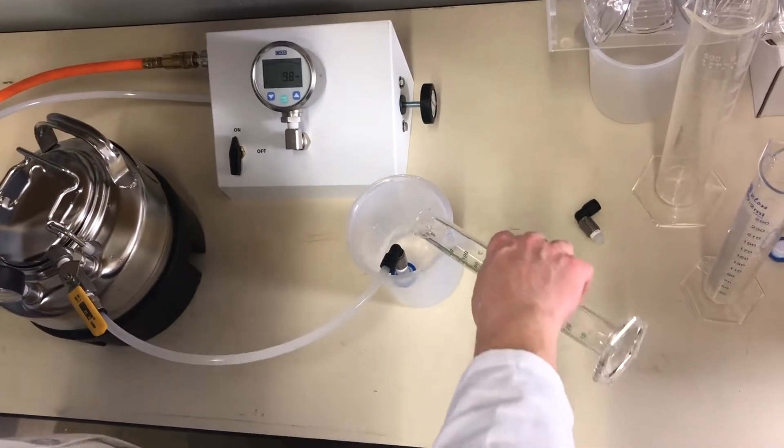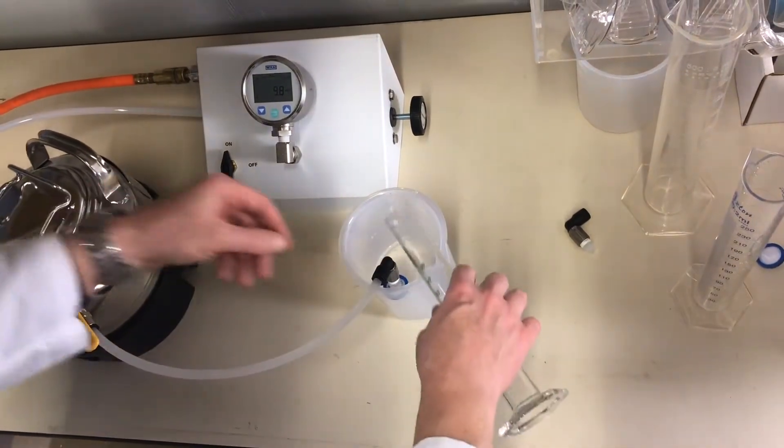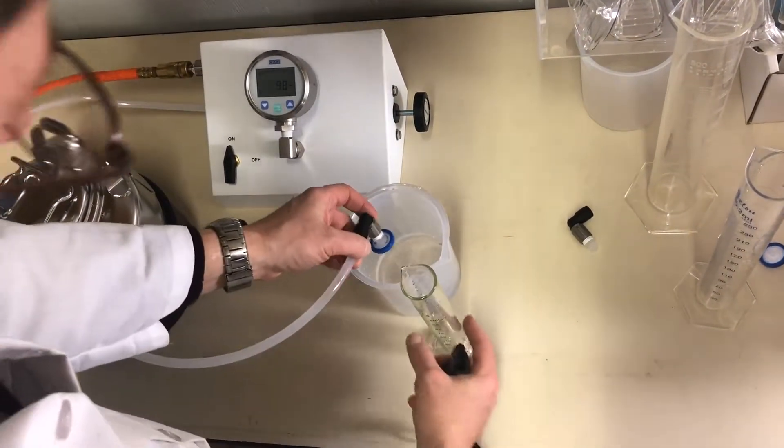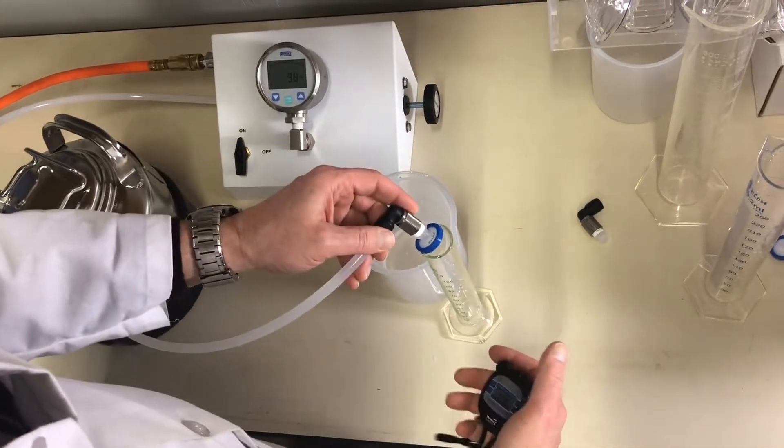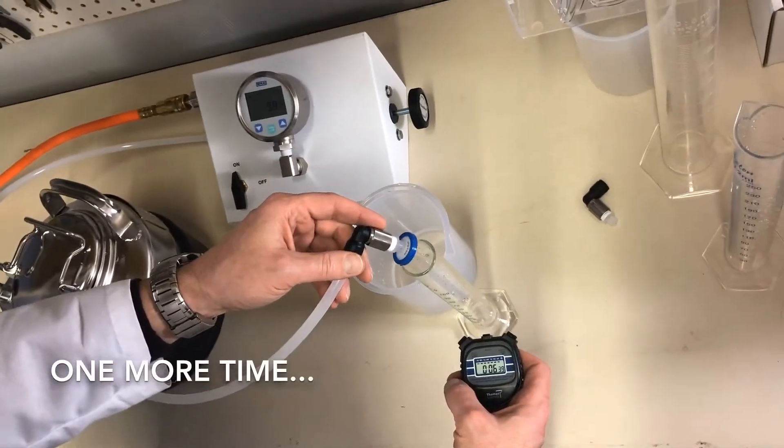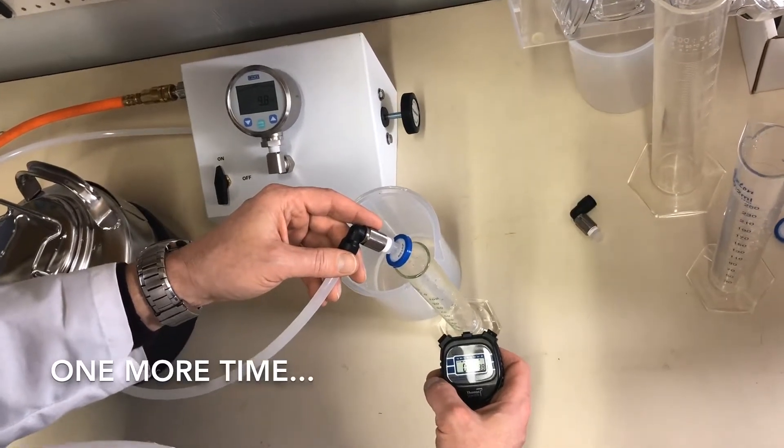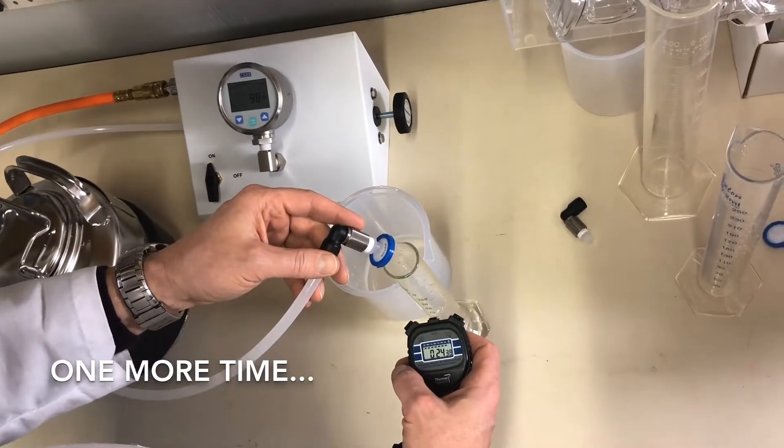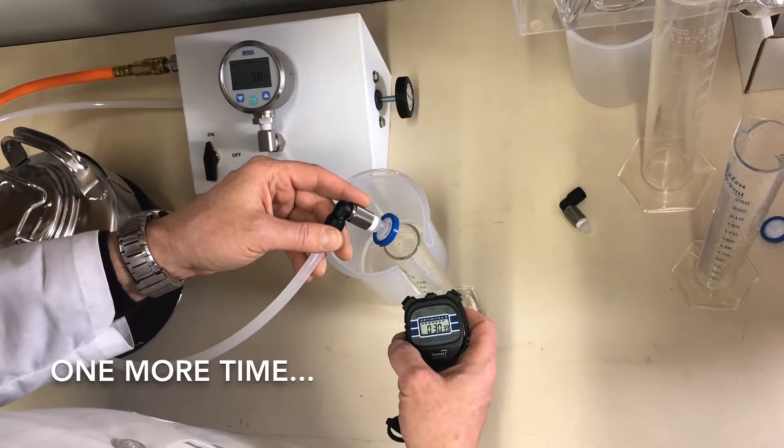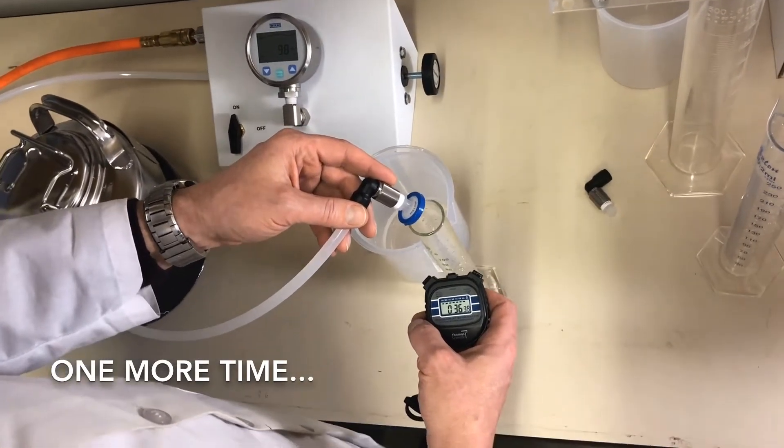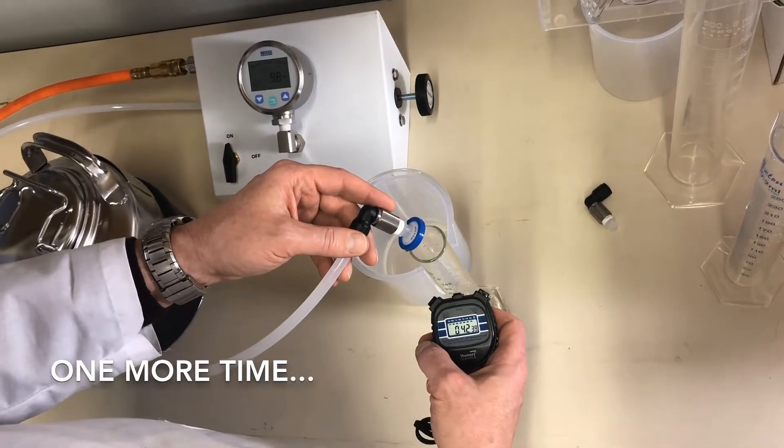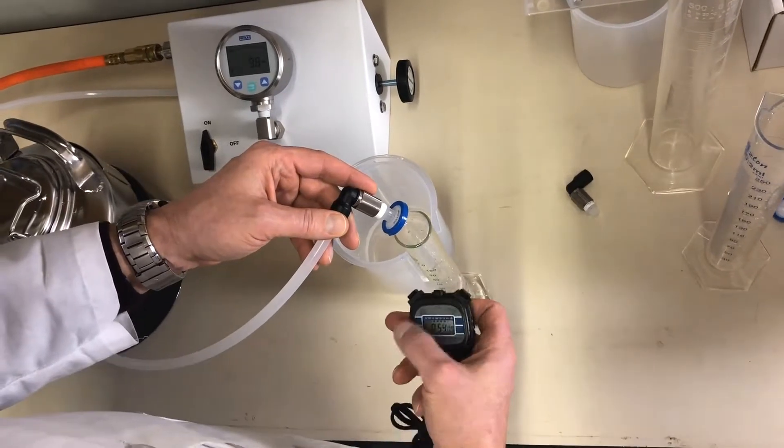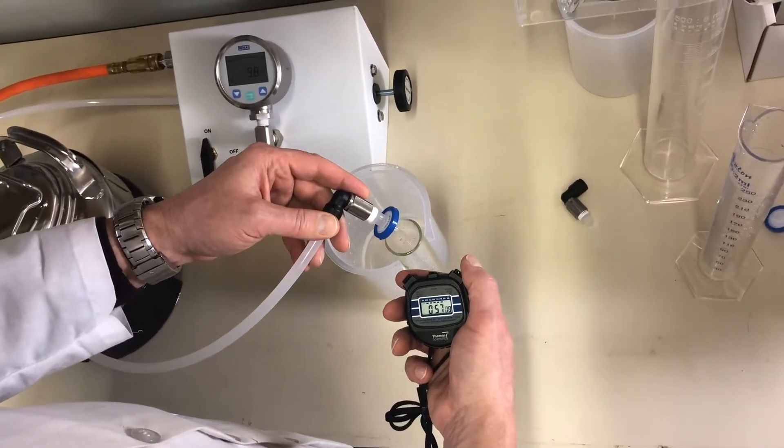After you measure that and record, you dump it into the beaker and repeat the measurement. So we'll stop the watch and then start it again and measure for one more minute.